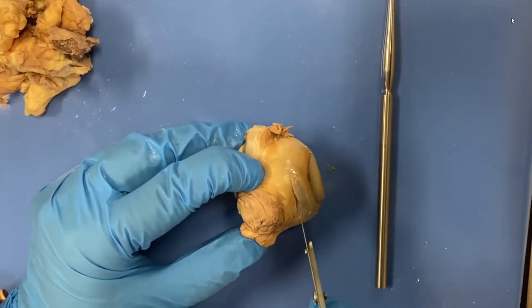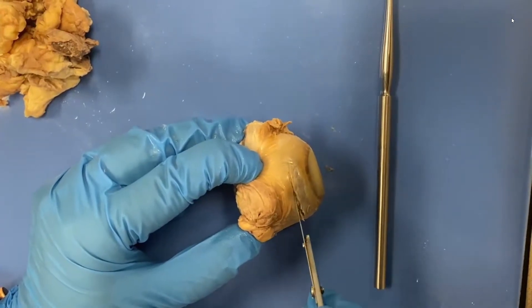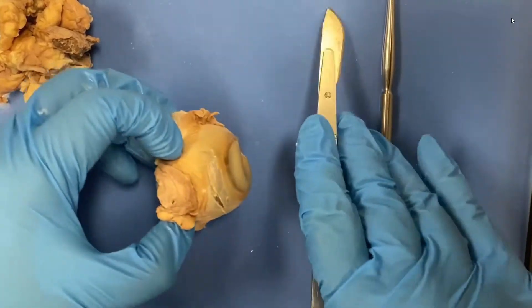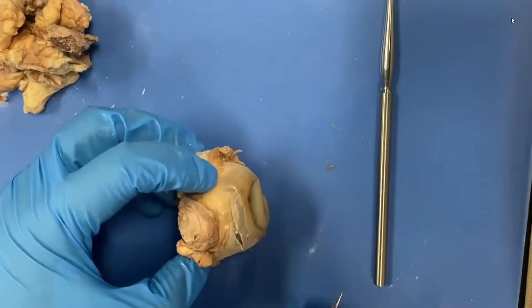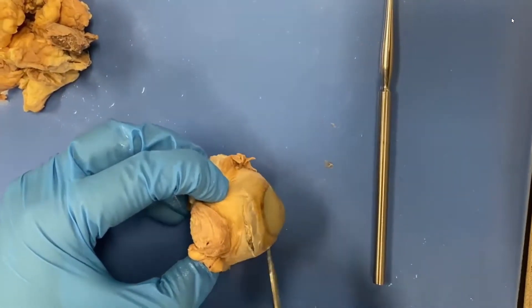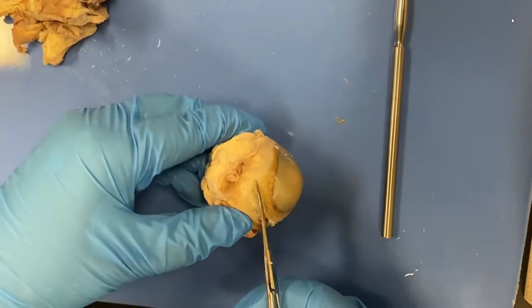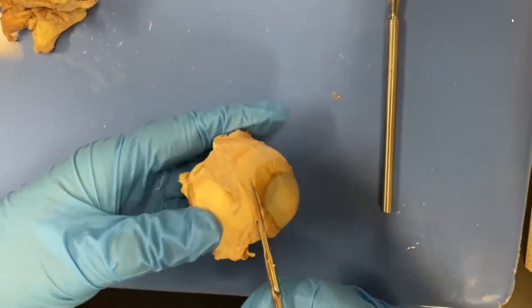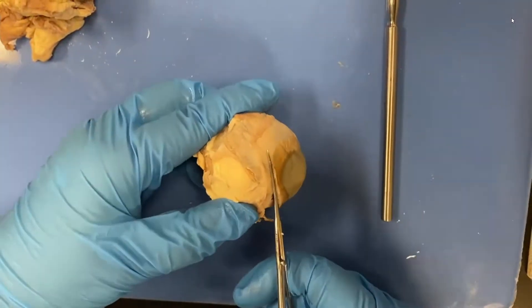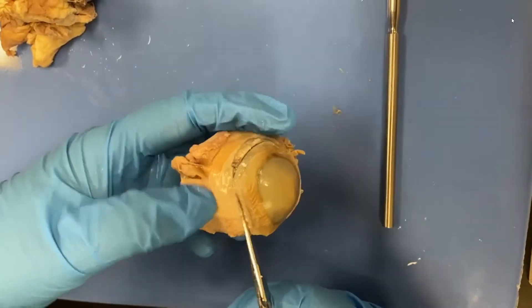I'm cutting just a little bit behind the cornea. This is a little bit tough, so I'm going to put the knife back and take my smaller scissors to make a little cut. Now I'm inside — I can actually go around with the scissors. Let's see how I've done; I'm going to take a peek inside. I think I'm doing okay. Come all the way around and meet my other side.